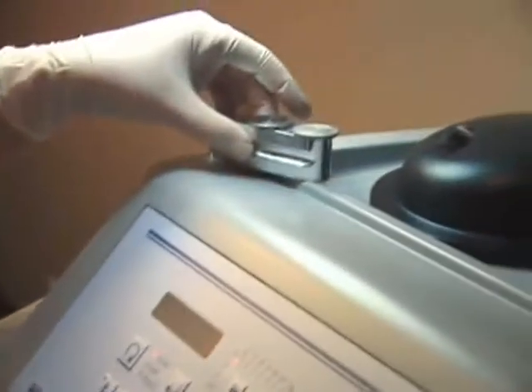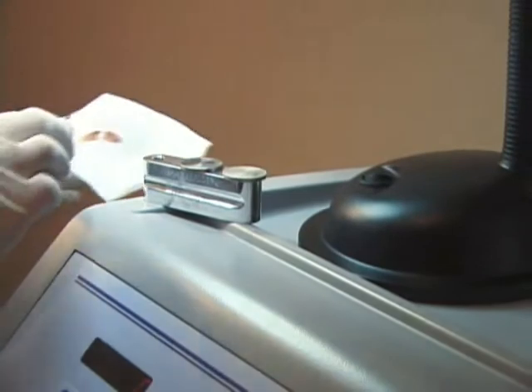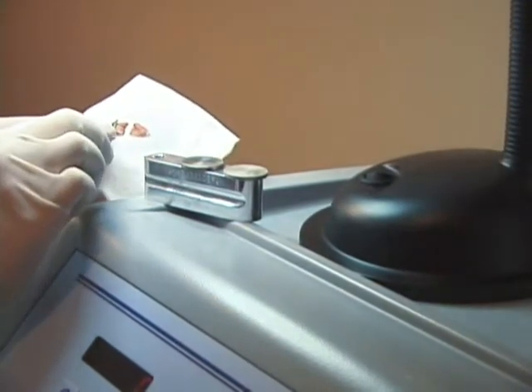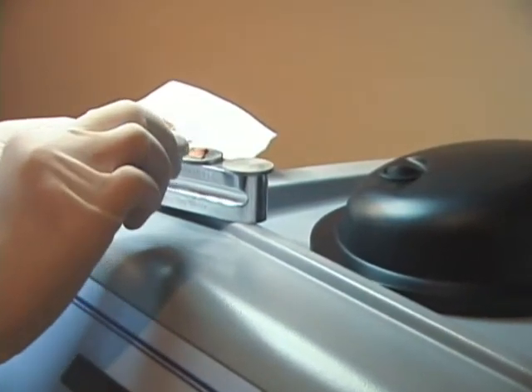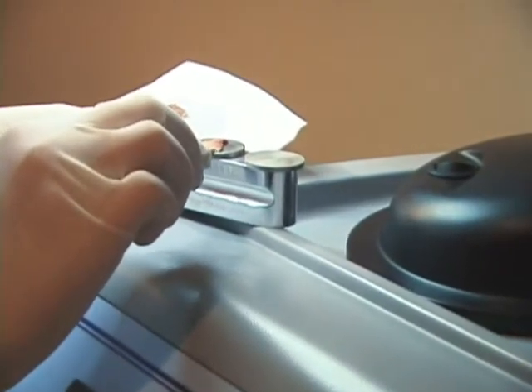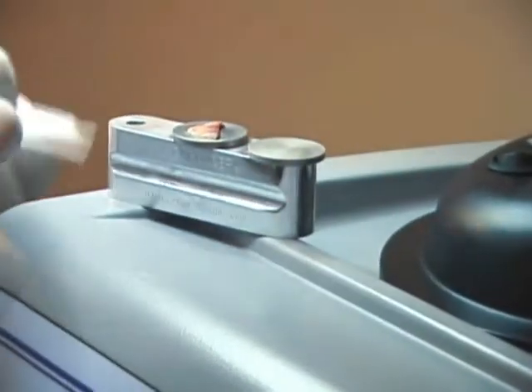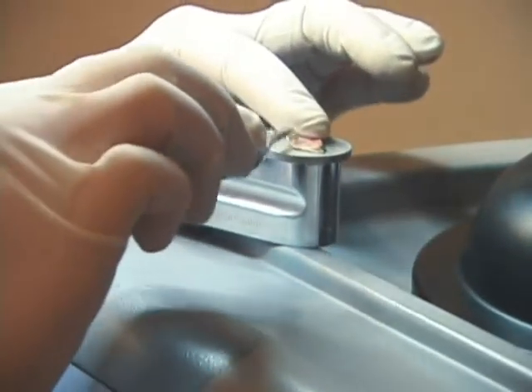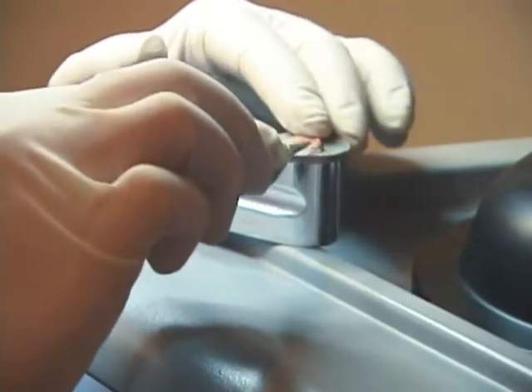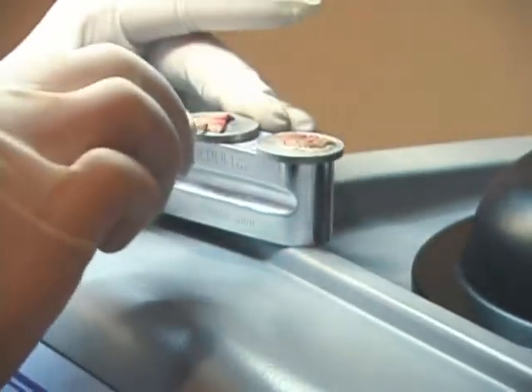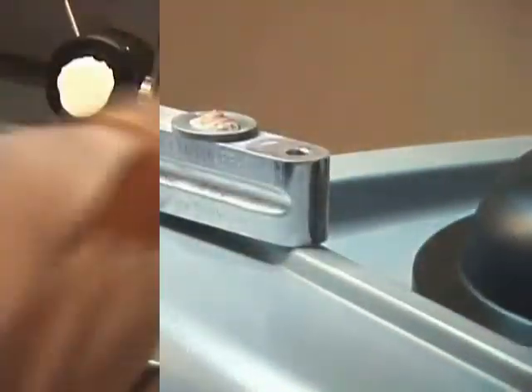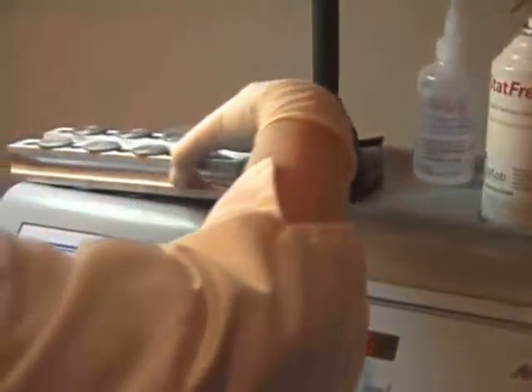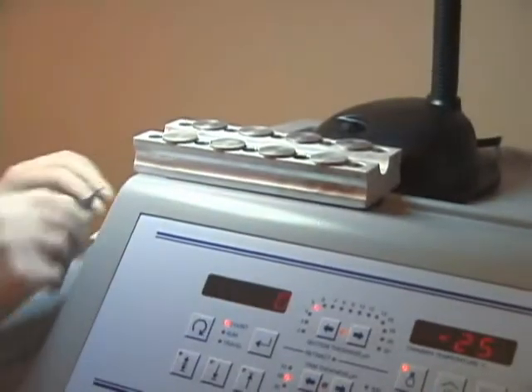Often specimens need to be bisected. With a cryo-embedder, more than one specimen can be oriented and frozen simultaneously. Simply place two or even three flat discs on the embedding device and freeze the samples at the same time. Many offices do Mohs on very large sites. Specimens this size have to be cut into smaller pieces in order to fit on a microscope slide. Using the chuck holder that comes with the cryo-embedder system, eight pieces can be oriented and frozen to where they are ready for cutting in less than three minutes.